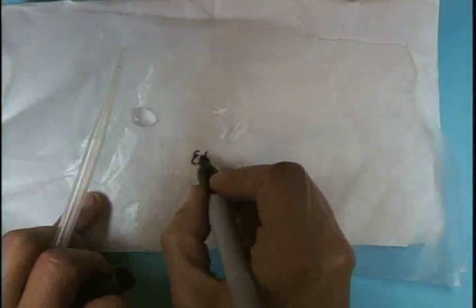And that was the ethanol. So I'll just write ETH for ethanol. Maybe you saw that drop moving when I wrote. Okay. And then the third one is hexane. Hexane is kind of a dangerous substance, so you will probably not find it in your school. It smells too.